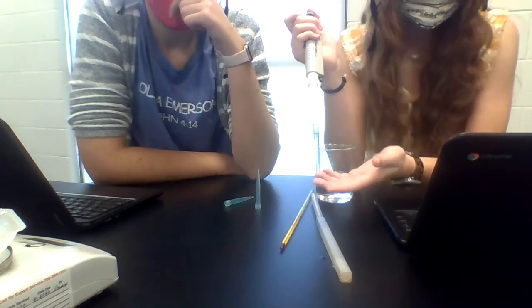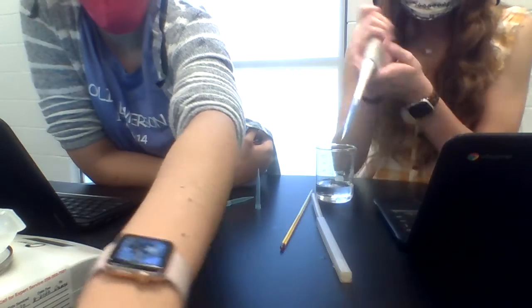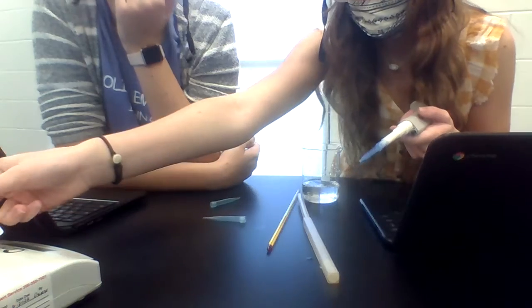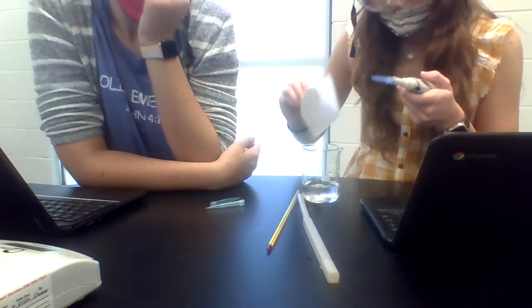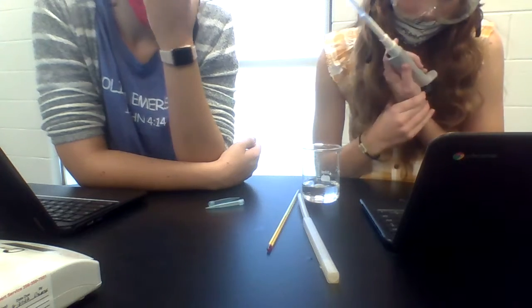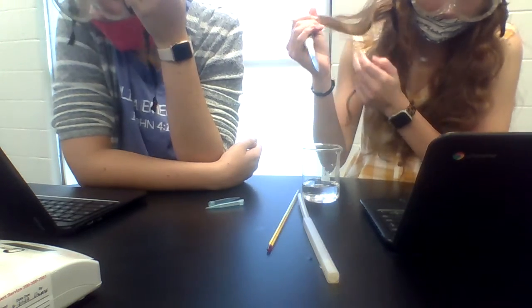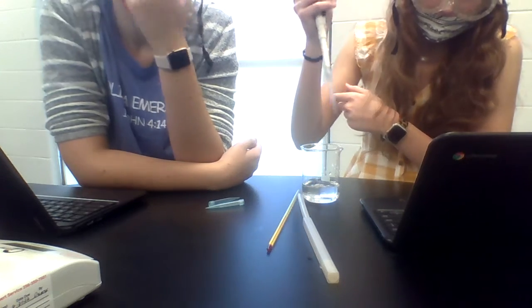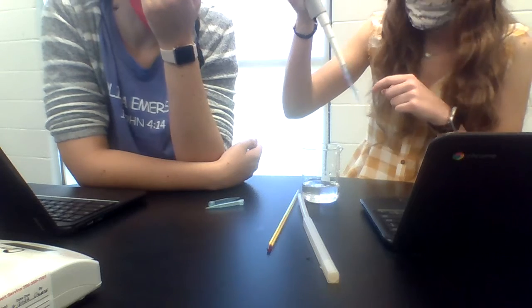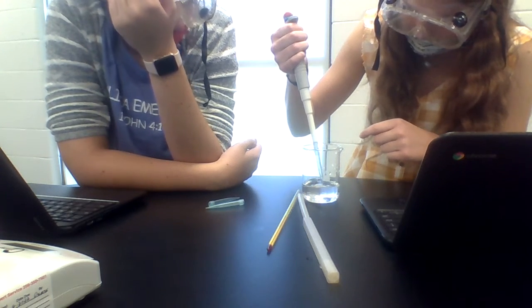Okay, this is micro pipette. So we need to tare the weigh boat, take that off. Tare. Now then, using the micro pipette, add 1 milliliter of water from the supply beaker to the weigh boat. So then this is our supply beaker. If you need more of the tips for the micro pipette, let me know.